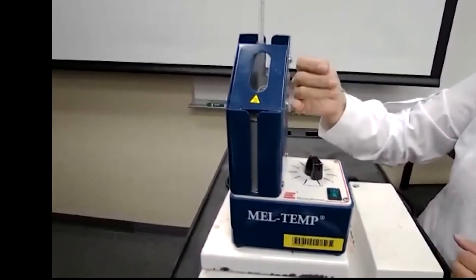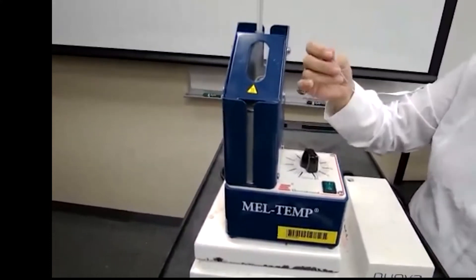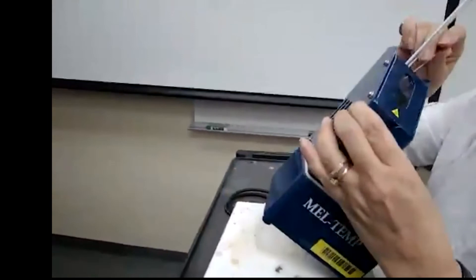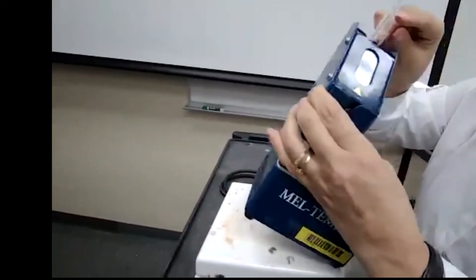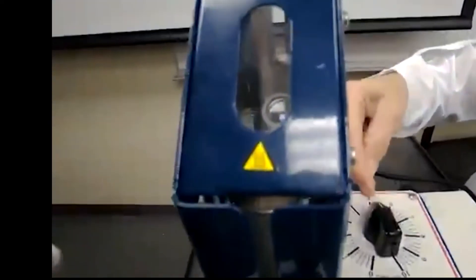Probably the temperature was higher than the 140. So, but it's approximately there 140, 150. I'm going to place the sample and set the heating or power regulator again between four to five.